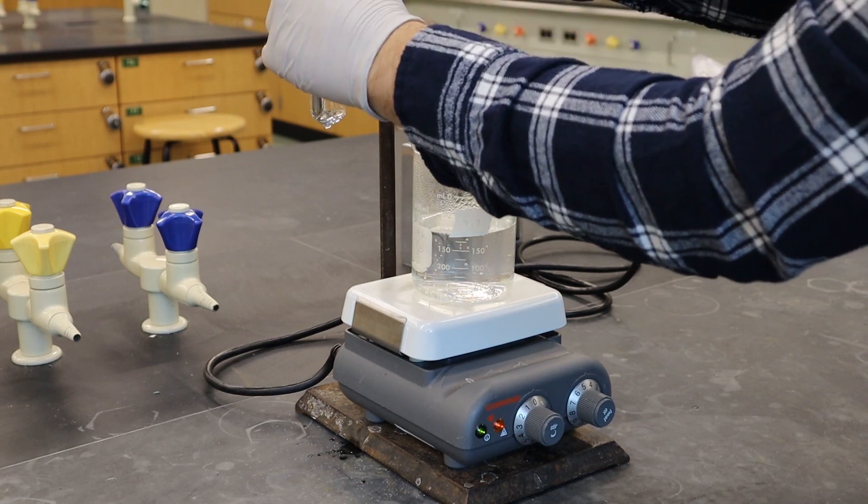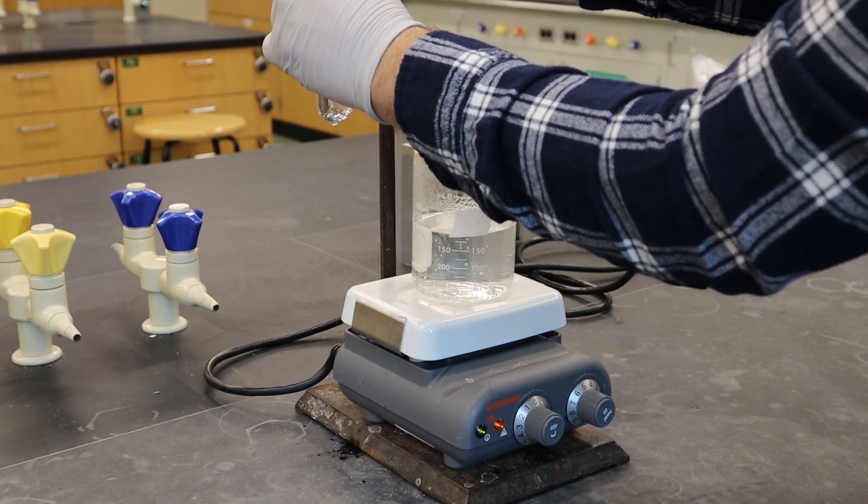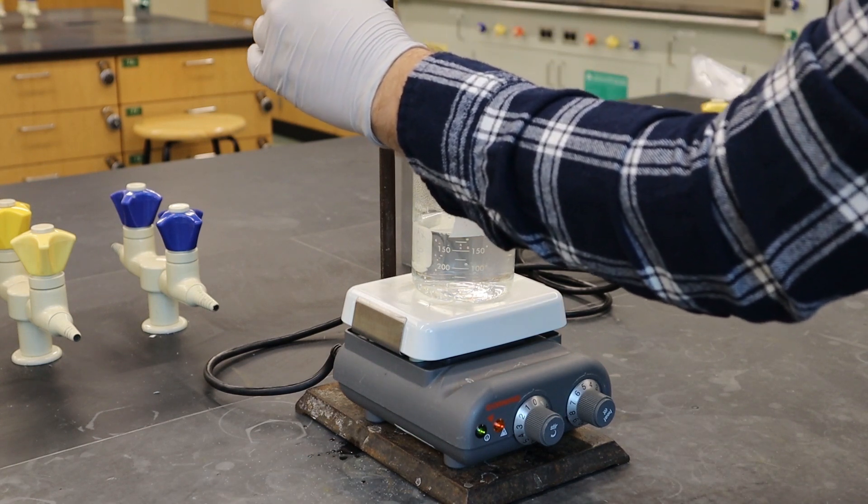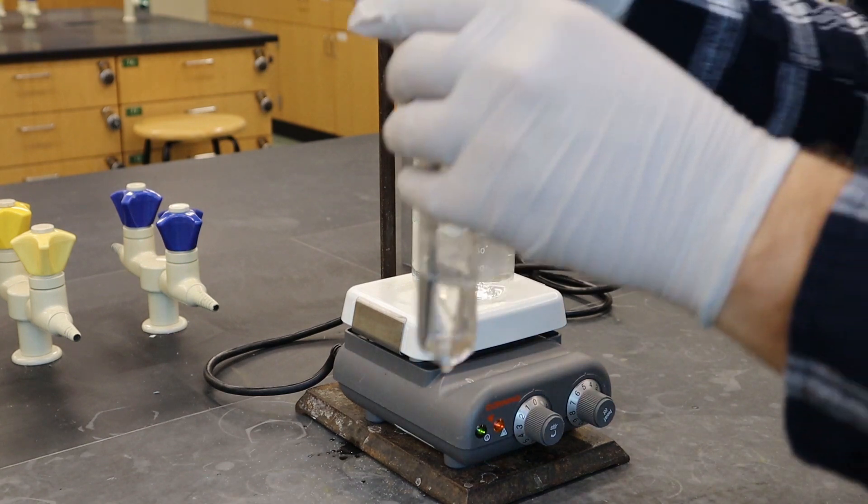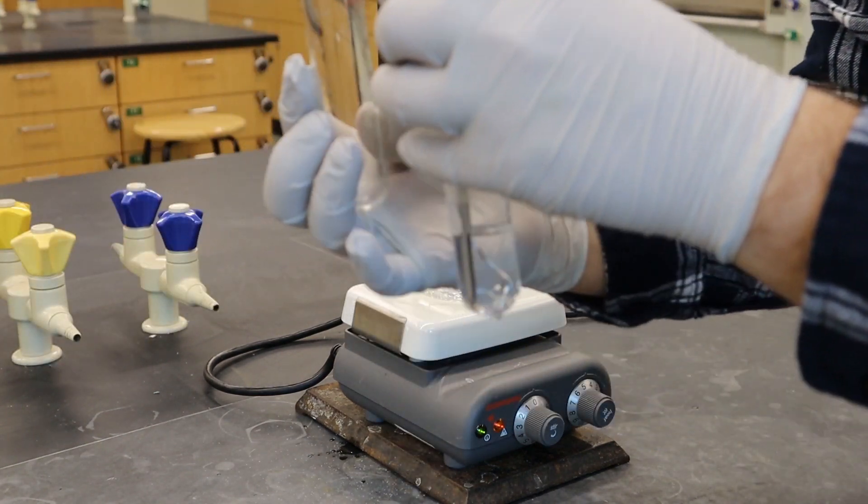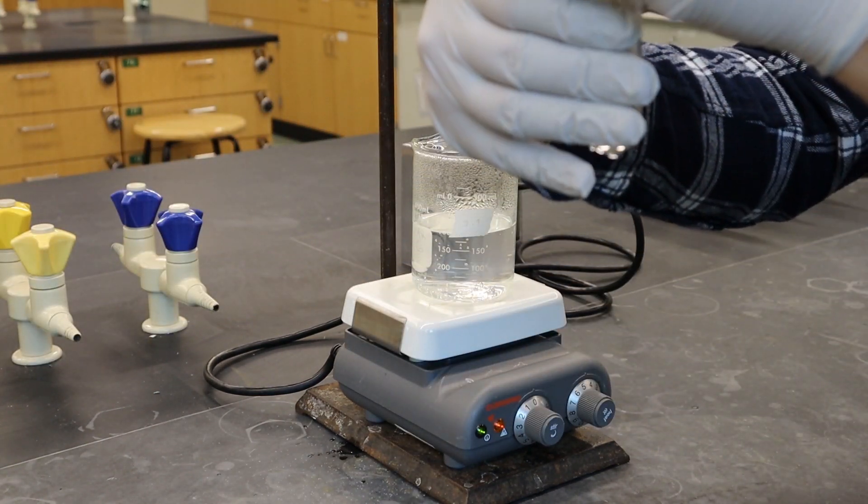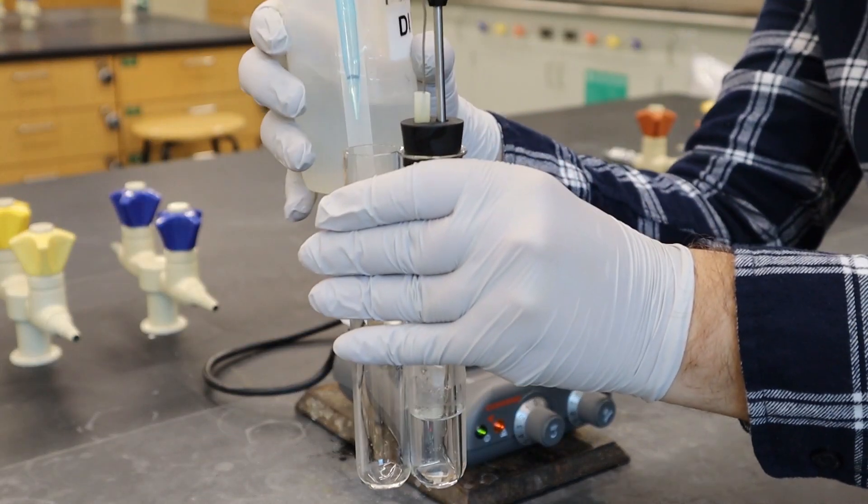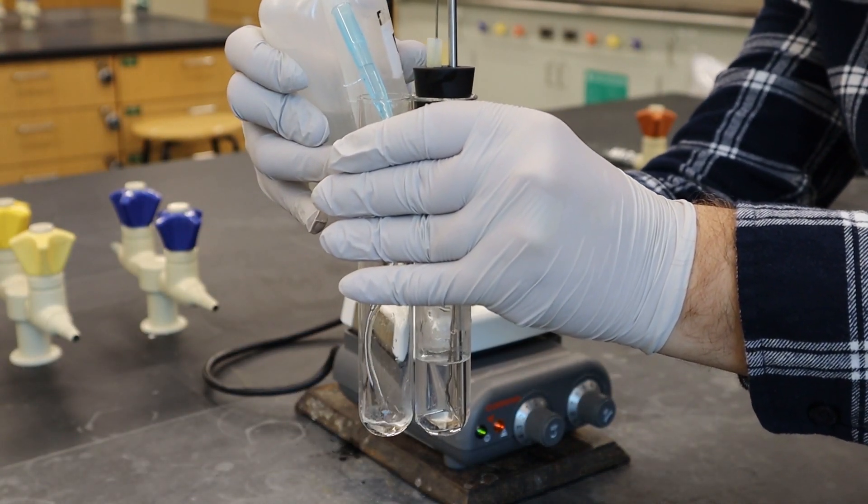All right so once you've got it all dissolved you need to make sure that all of it's dissolved, like absolutely all, there's no actual solid in there. And then you have to use another test tube to measure out how much volume that is.